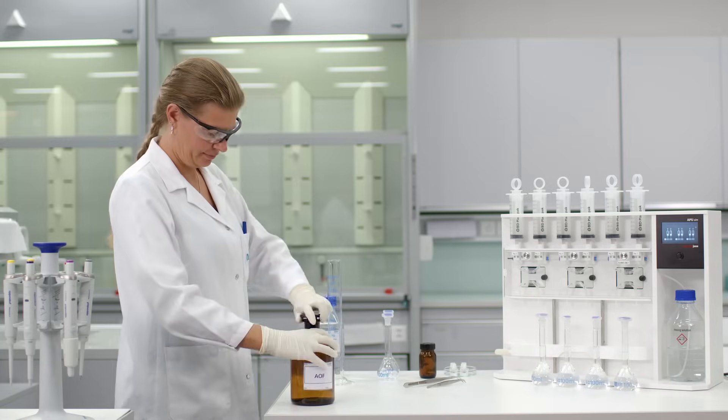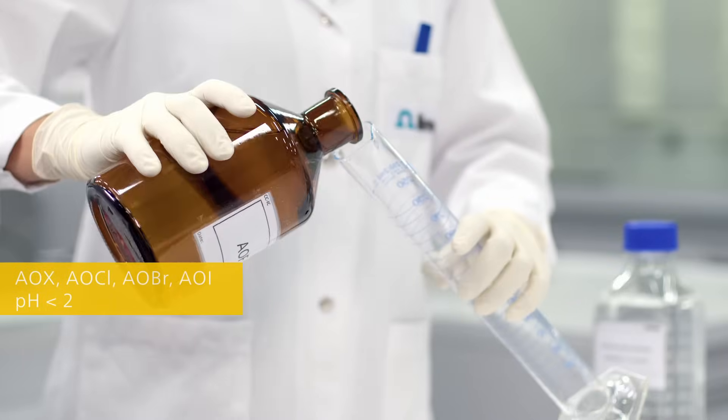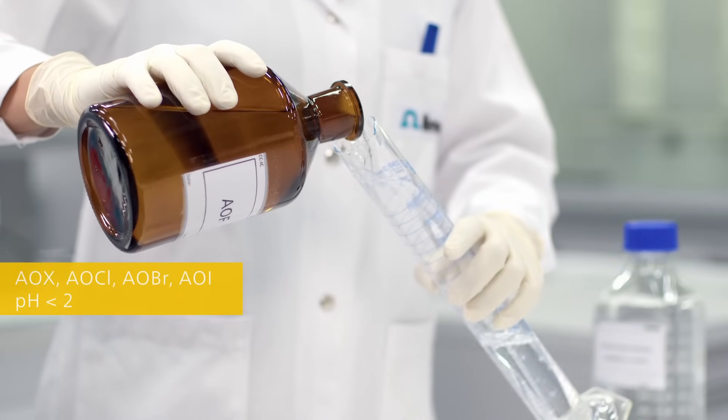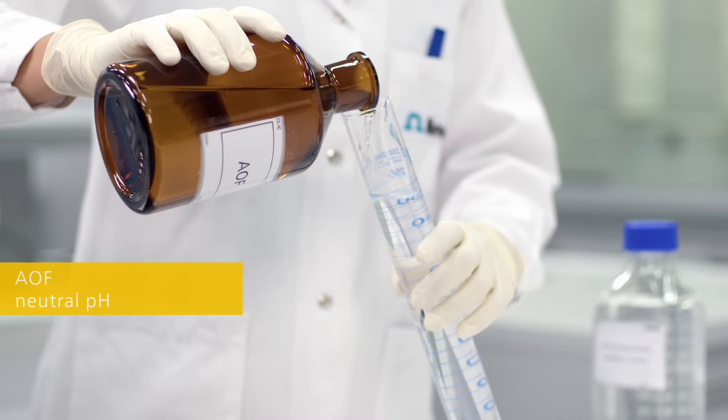Let's start with the sample preparation. AOX and AOF samples are analyzed separately. For analysis of AOX components, the sample pH needs to be adjusted below 2. For AOF analysis, the sample needs to be neutralized.